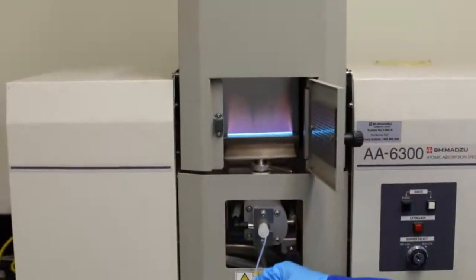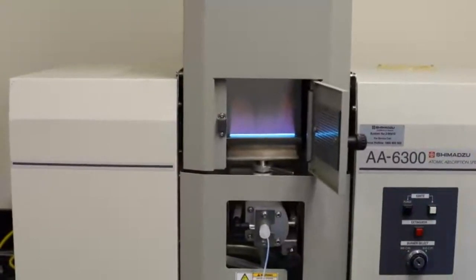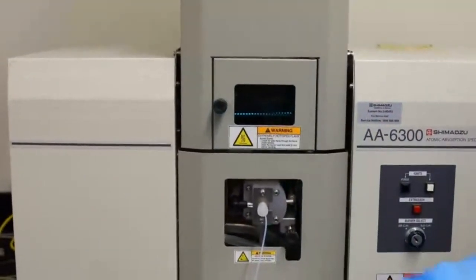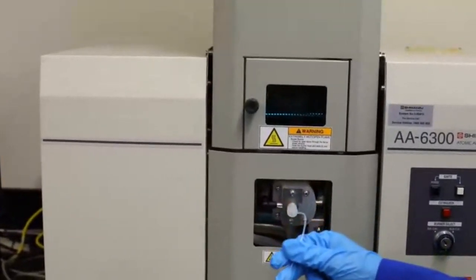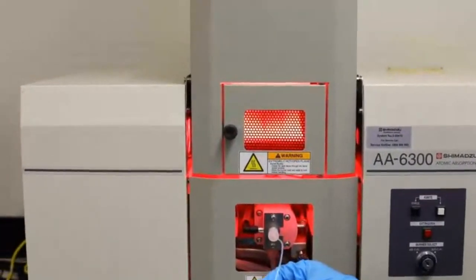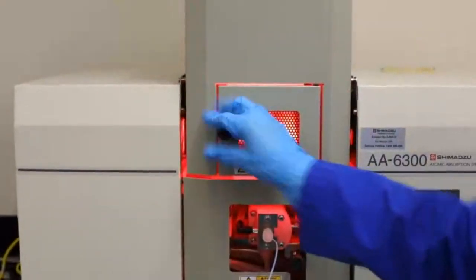Holding on a little bit there. Okay, now the next one I'm going to leave the door closed because it's bright. We have our strontium. So you can see it just going up the system. I'll open it for 5 seconds or not even that much. Really bright.